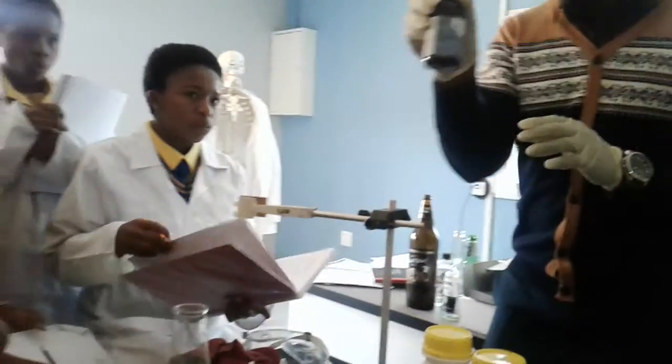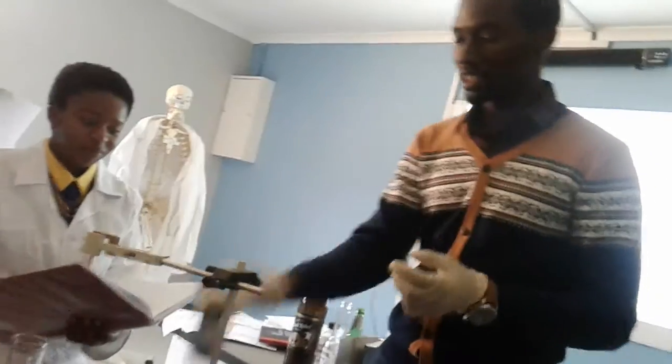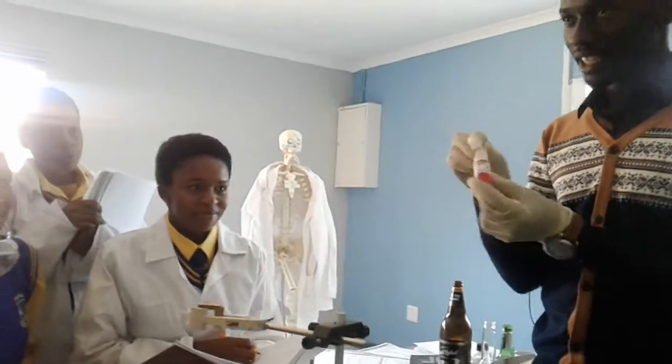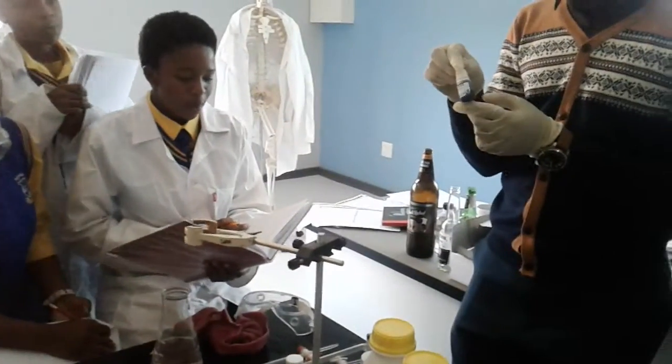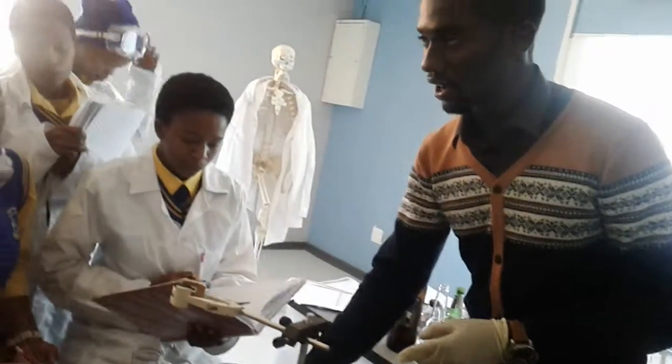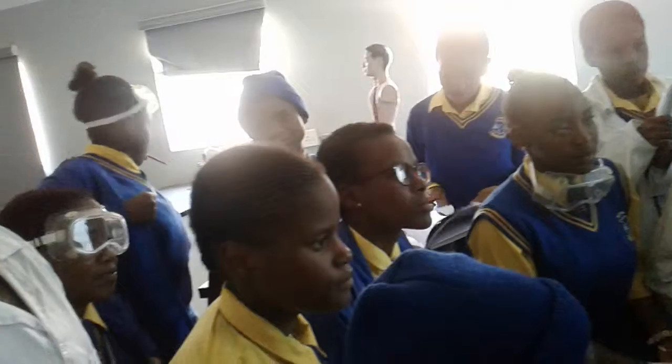What do we have? What's the first indicator? Okay. What's the second indicator? What's the third indicator? Okay. Now, talk to me. Out of these three, which one is used when I have a strong acid and a strong base? Strong acid and a strong base.